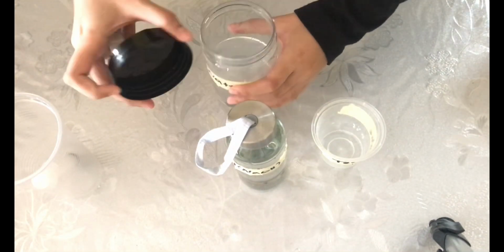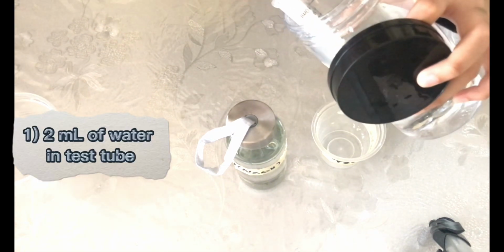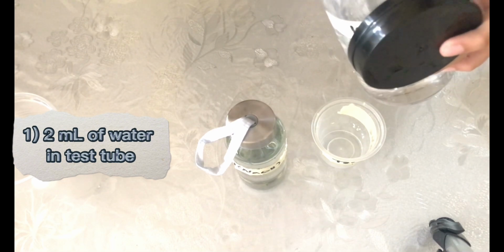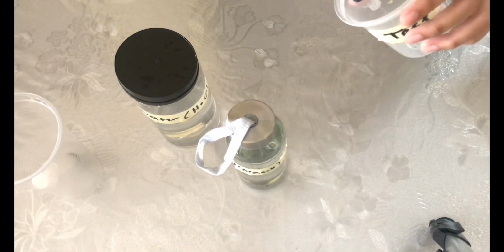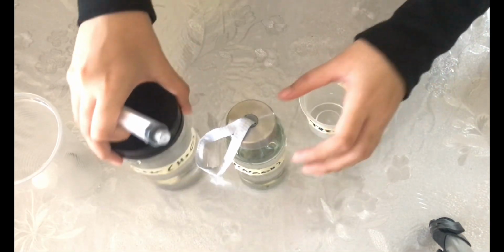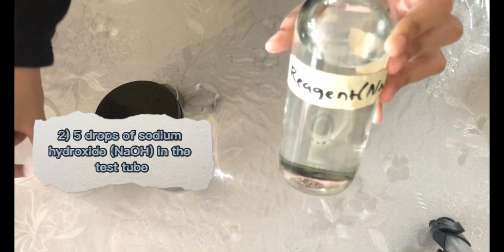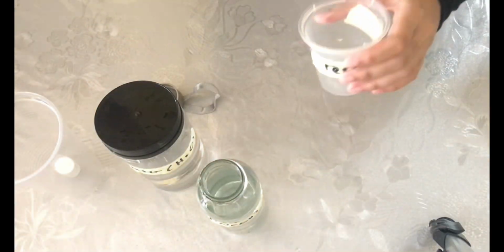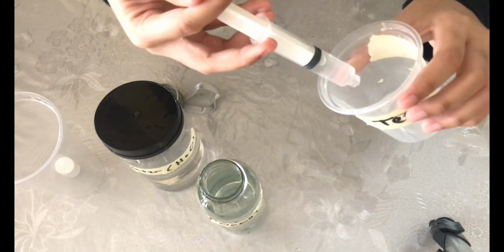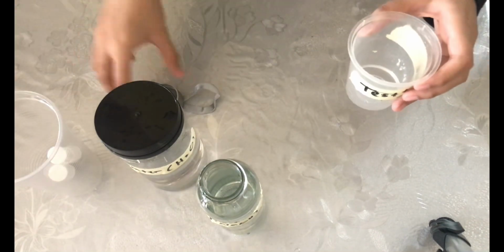So first, after I've cleaned and rinsed a test tube with high purity water, I'm going to add 2 ml of water into the test tube. Next, I'm going to add 5 drops of sodium hydroxide solution into the test tube. And then I'm going to wait for a while to observe the result.